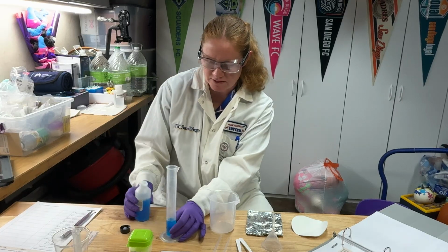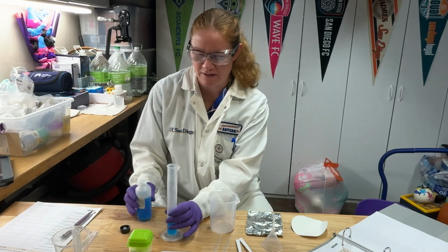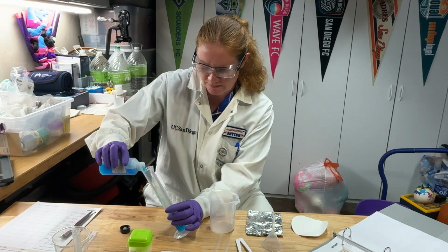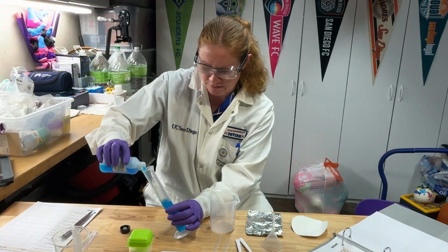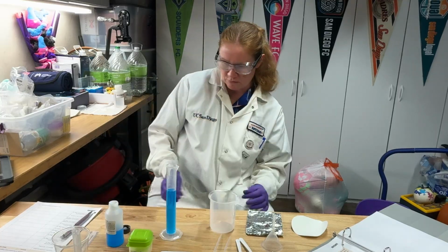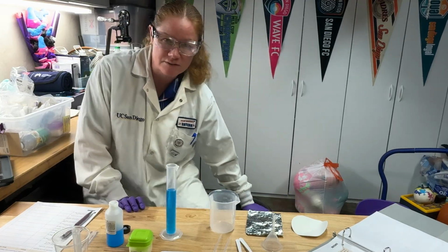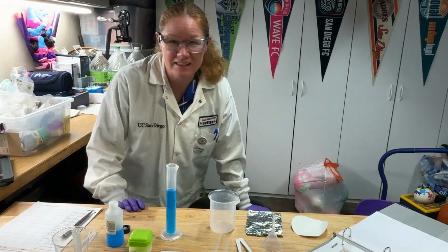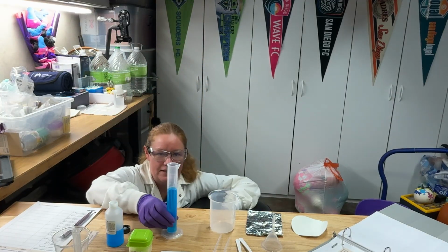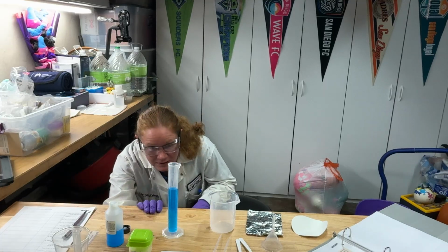Now, one thing to pay attention to is if you get a lot of air bubbles, that will affect your volume reading. So I'm going to carefully pour down the side. I don't need to get it exactly to 50 mils this first time because I'm going to be recording the exact volume. So I'm going to stop there. That way I don't overshoot it. And if for some reason I end up needing a third one, all I have to do is add all the numbers.